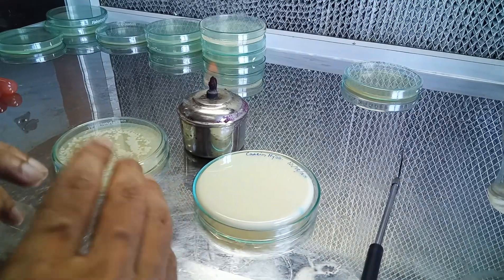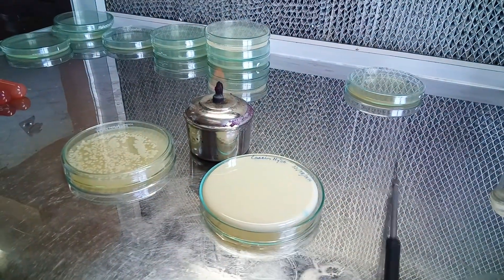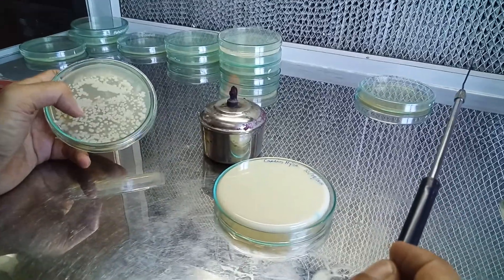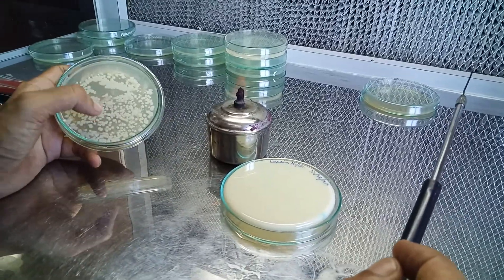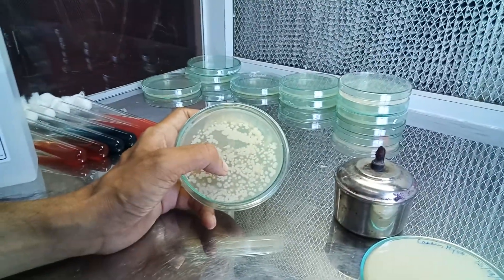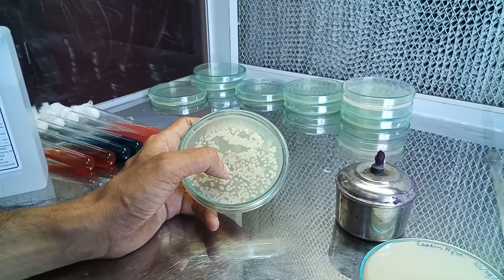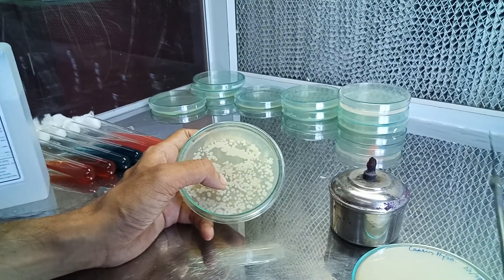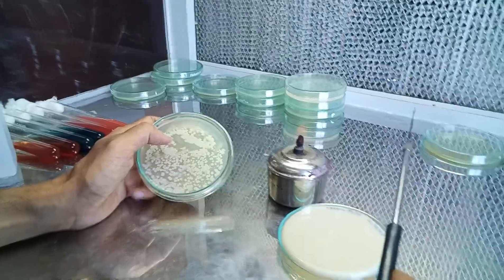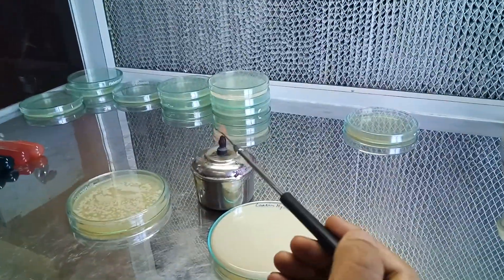This is a test to determine whether the organism we have as the test culture today — these particular colonies of bacteria — are capable of breaking down casein or not. To carry out the casein hydrolysis test, we will begin by heating the loop.